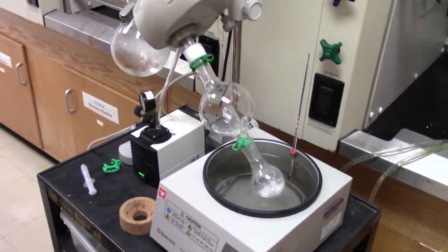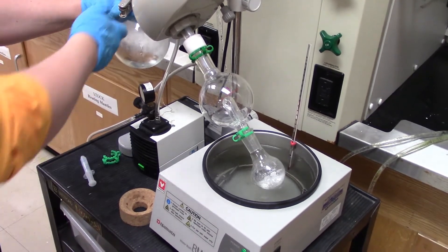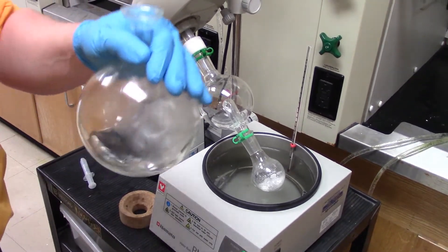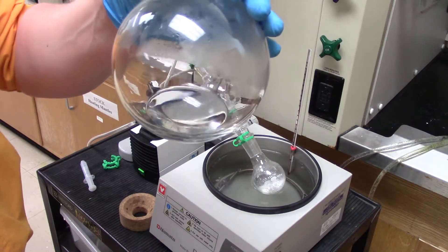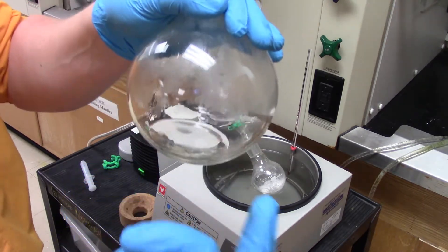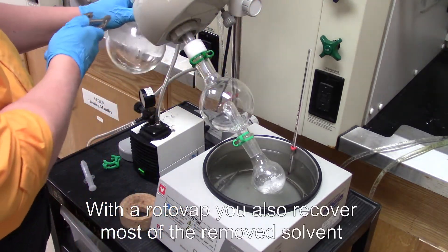And what you can see back here, and hopefully you can see it, is I've got a nice little reservoir here of the solvent that came off. So actually when I get done with this video, I'm going to cheat and use this solvent to get out my condensed material.